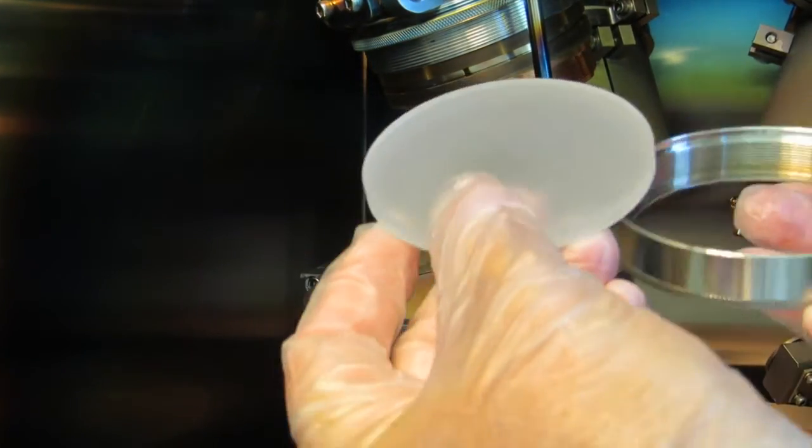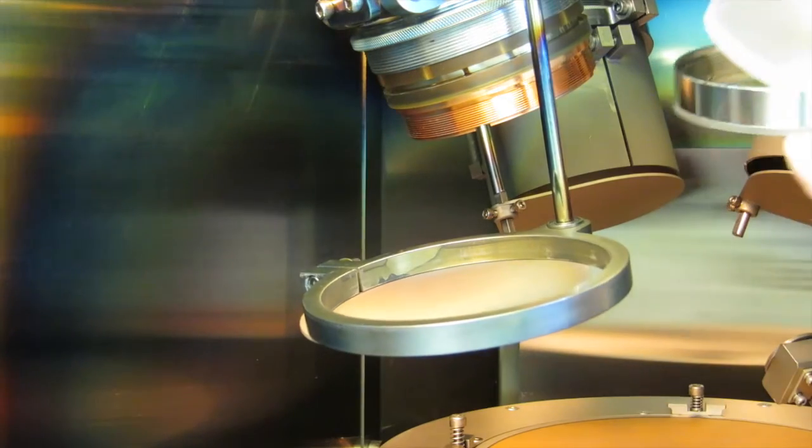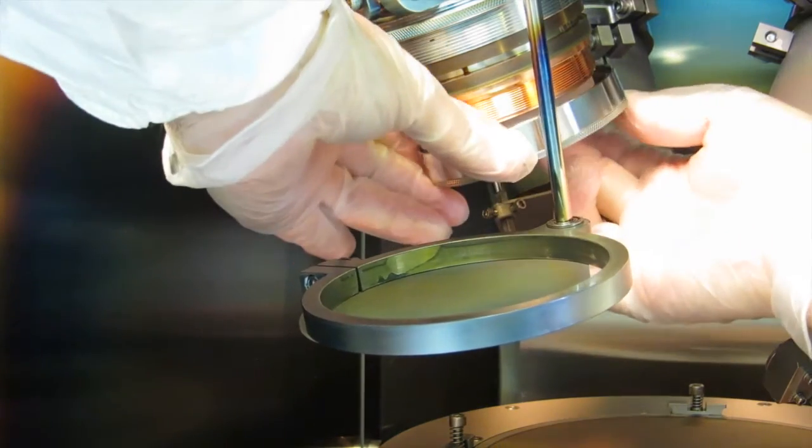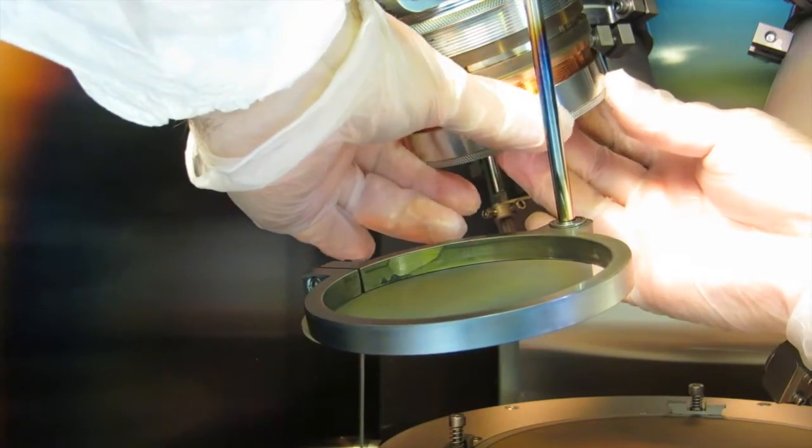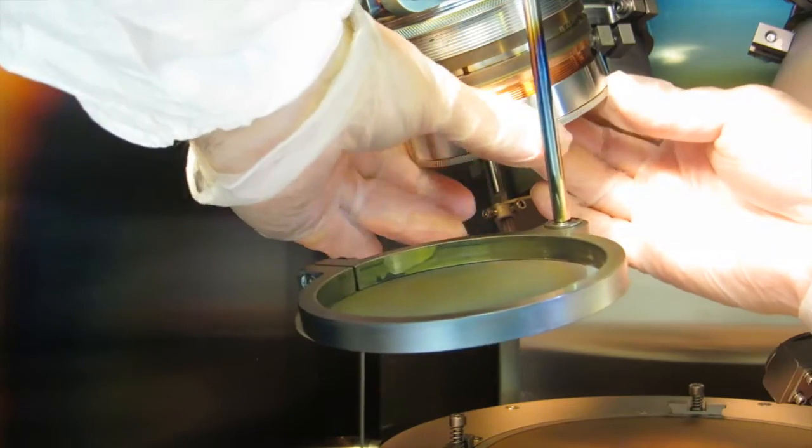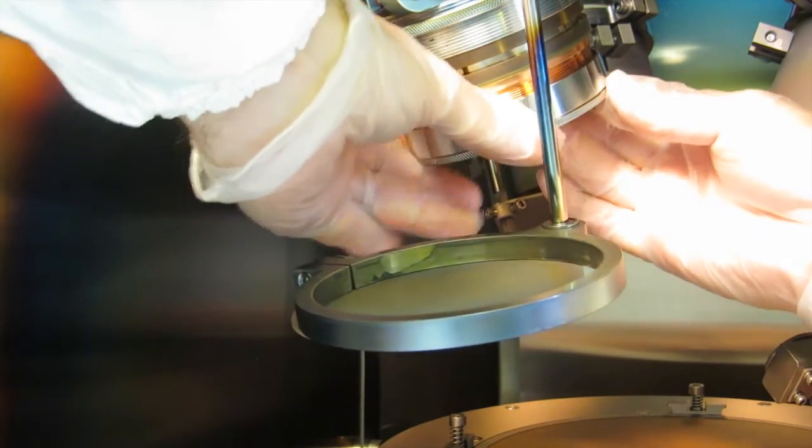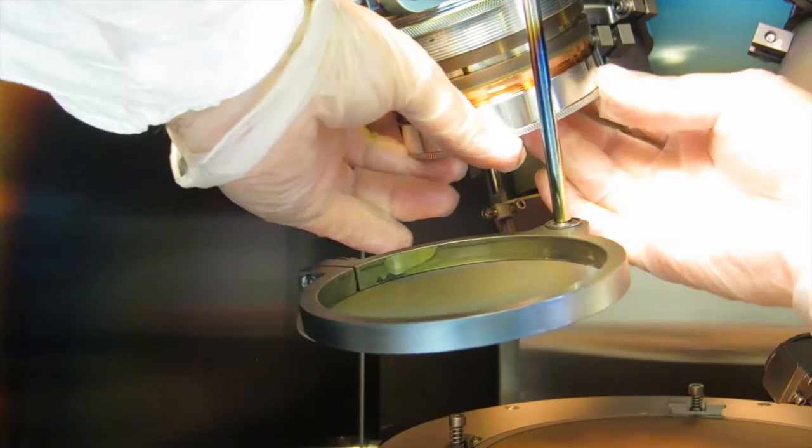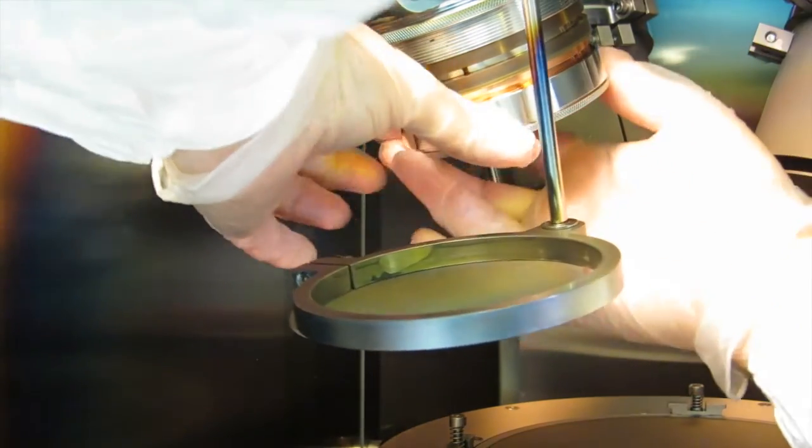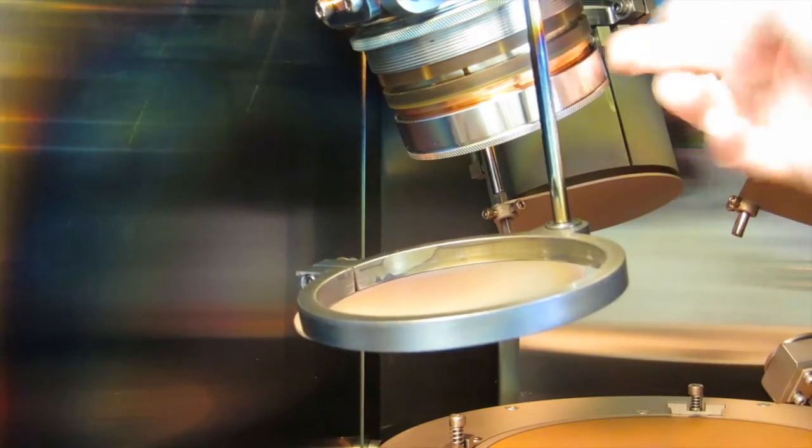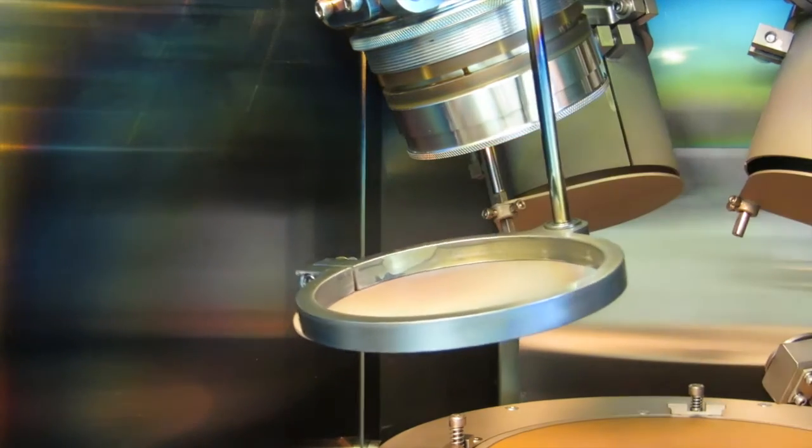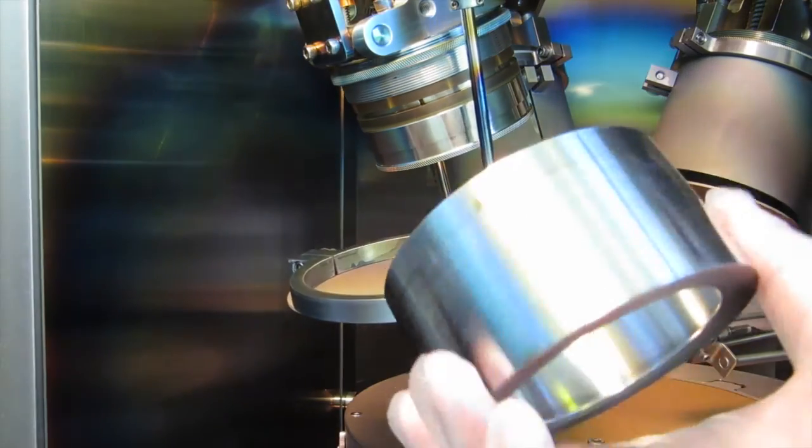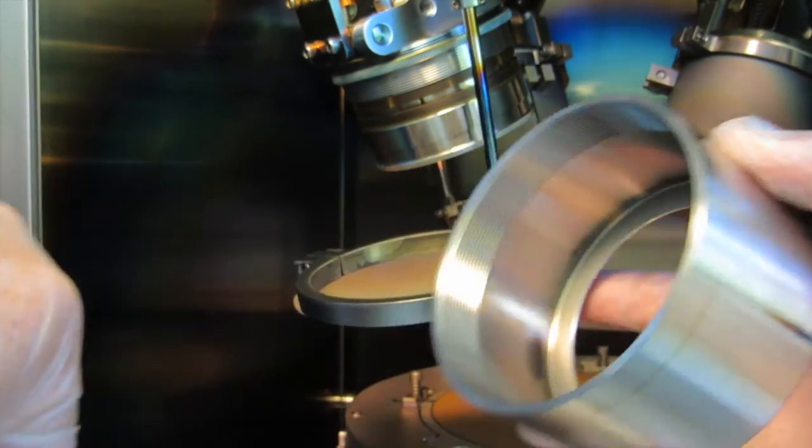I'm going to replace the iron target with an SiO2 target. This is the way that I found that it's easiest to do it. Stick your fingers through the ring. That way you can use one finger to hold the target in place while you line up the ring and get it started. Be real gentle with it so you don't damage the threads. They're very fine threads and it's easy to cross-thread it if you're not careful. Just spin it loosely until you feel the threads finally catch and then it should rotate on easily. You keep going, just grab it by the knurled rim and go up until it's snug. Once you have it snug in place then you slide up that ring to protect the copper from being sputtered on. You don't need to torque it on really tight, just finger tight so that you don't damage the threads.